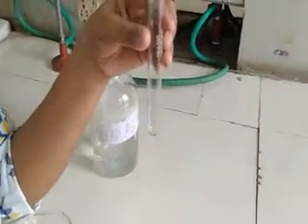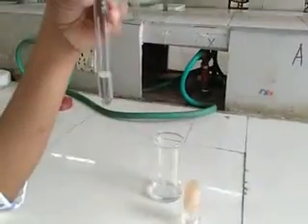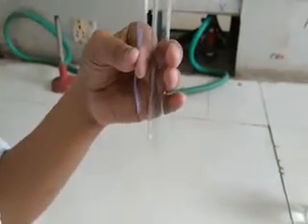Now we will carry out the test for sulfur. For that, I will take 2 ml of Lassaigne filtrate in a test tube and add lead acetate solution to it. As you can see, there is no black color formation, which confirms that the given organic sample does not contain sulfur.